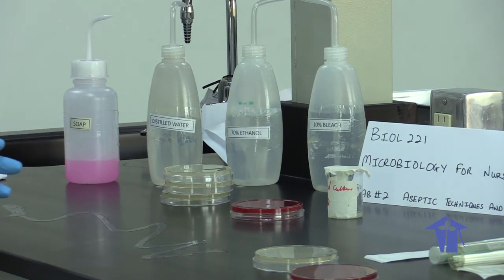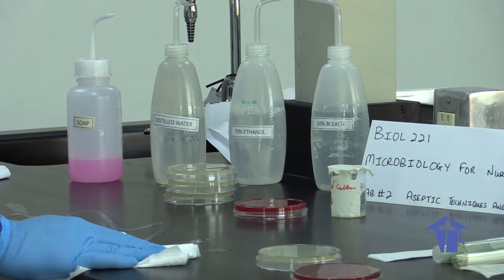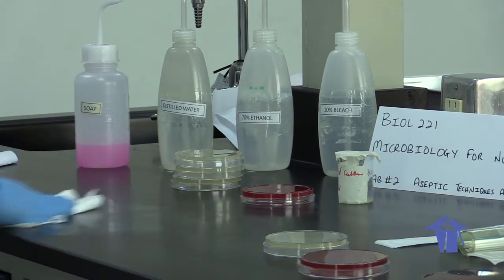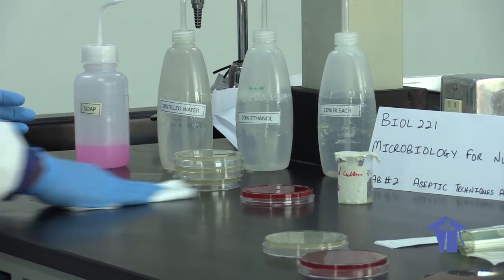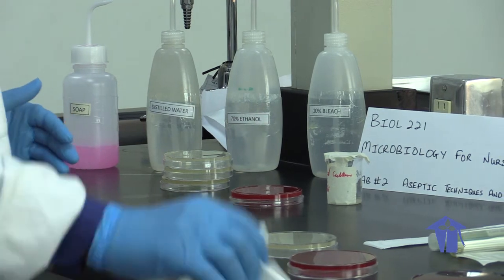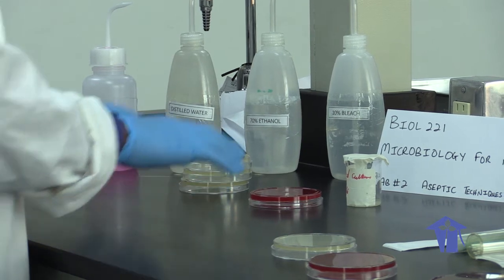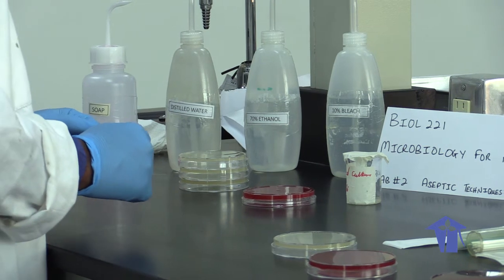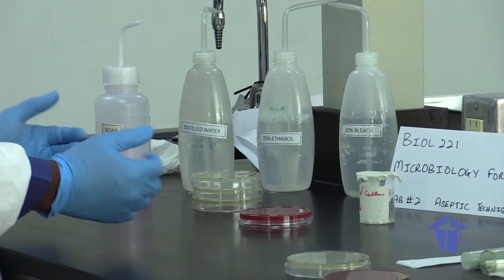Aseptic technique is all about working in a safe and clean way in your environment. It starts with cleaning your workstation — I'm just wiping down this countertop with 70% ethanol. This would have been done before, but I'd like to just double check and be extra cautious. Once your workstation is clean, your plates have been sterilized in the autoclave, so you know that you have a safe surface to work with.